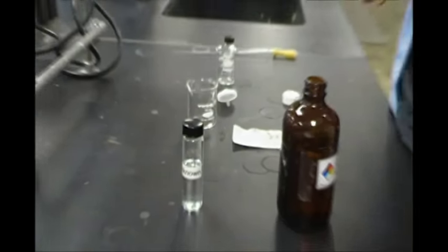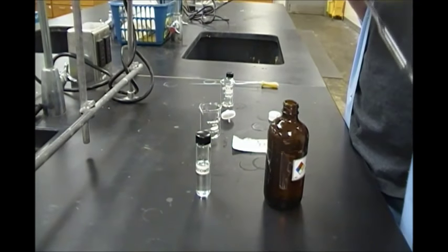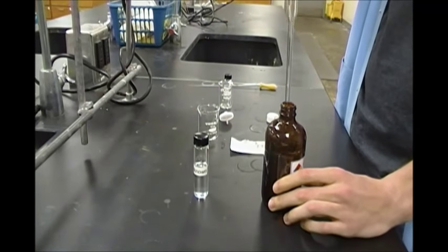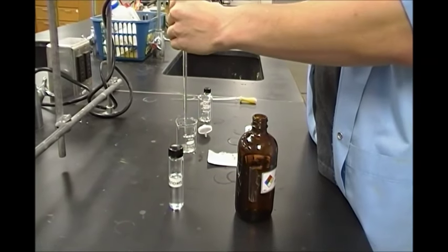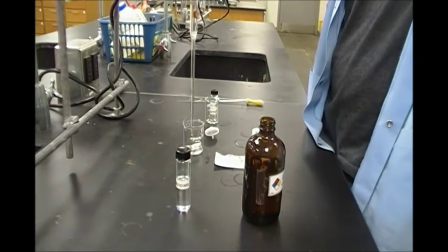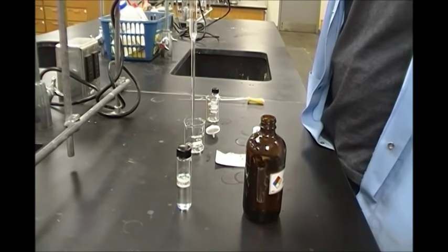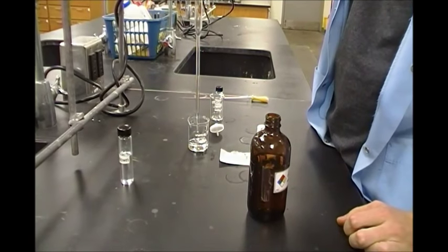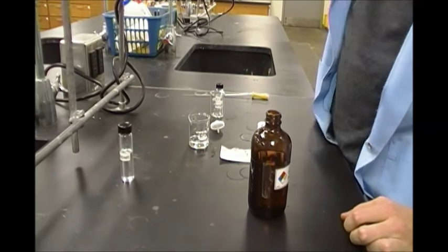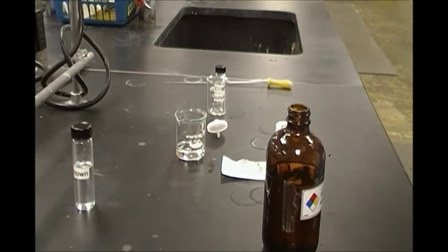So to do that, we will take 10 milliliters of our solvent. I'll just place it here. Okay, so we have 10 milliliters of our solvent there.